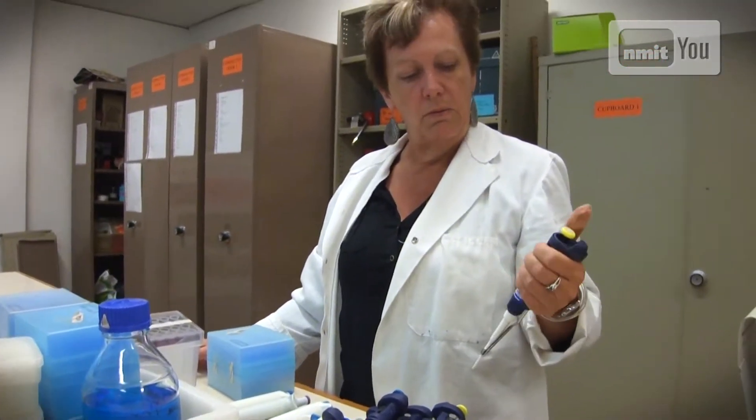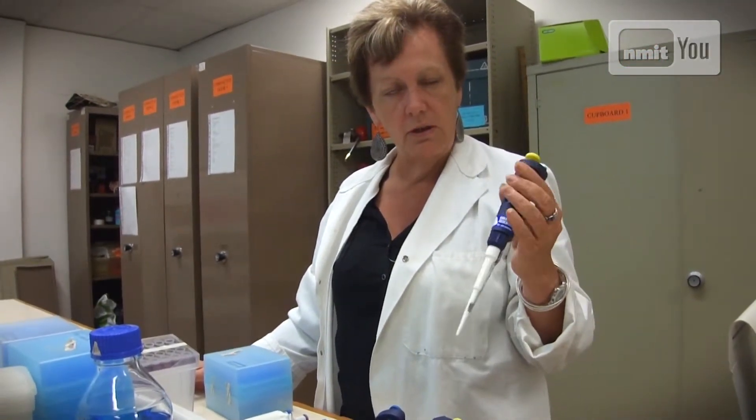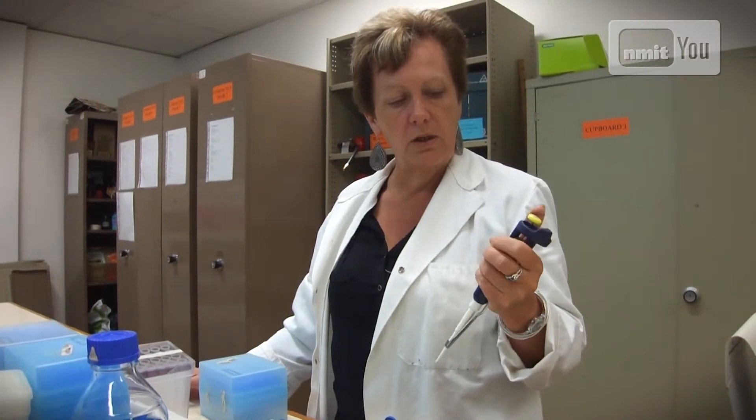What I'm doing now is teaching students how to use an autopipette correctly. They suck up the fluid and you have to use them in a certain way to make sure you're doing it properly. It has a clicking system — you go to the first click, draw up your fluid, and then go to the second click to dispense it into something. It sounds easy but you've got to be able to feel it, and it takes a while.